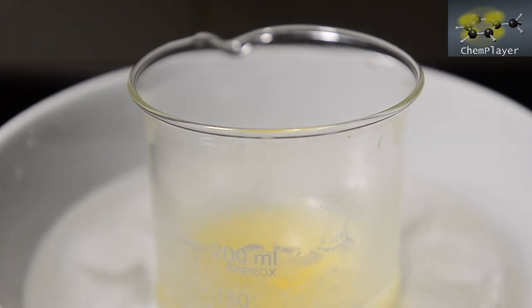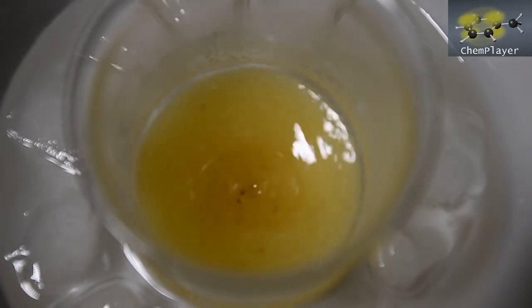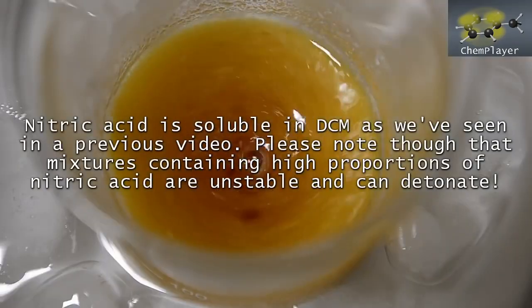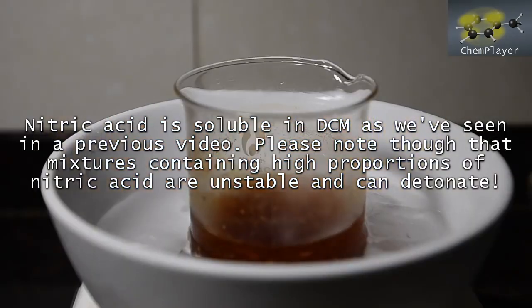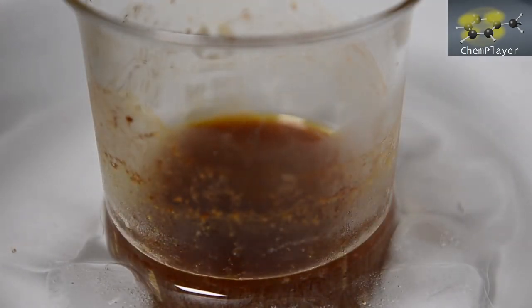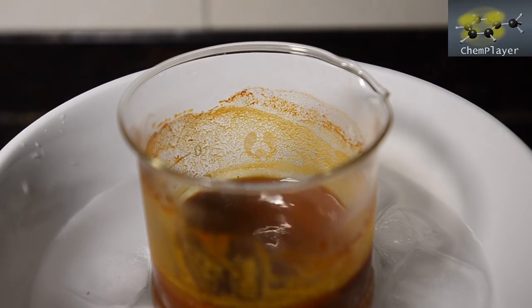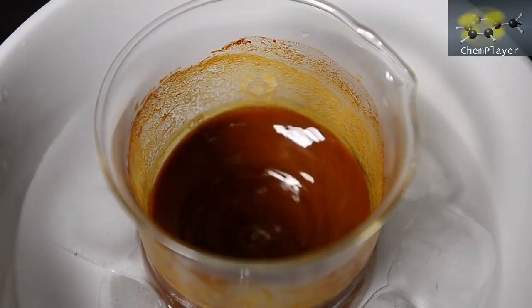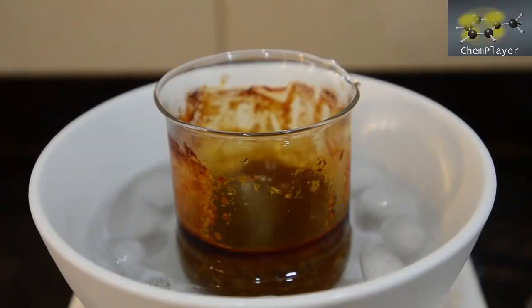There's an immediate yellow color produced, and the aqueous blobs in the stirred mixture turn red. We'll keep adding slowly. Another thing about dichloromethane is that nitric acid is pretty soluble in it — although there's some water in the nitric acid we're adding, it's likely that some of the pure nitric acid is passing into the DCM layer containing the vanillin. Soon we've got a yellow-orange colored precipitate forming, and the mixture is a red color. The temperature is under control, but we notice that if we add more than a few drops of acid at one time there's a slight bubbling of the reaction mixture.